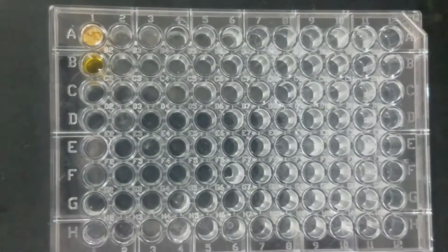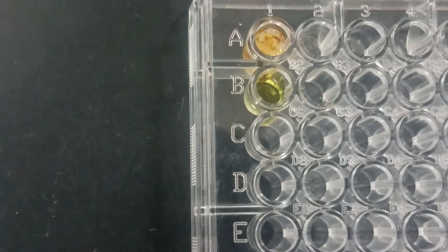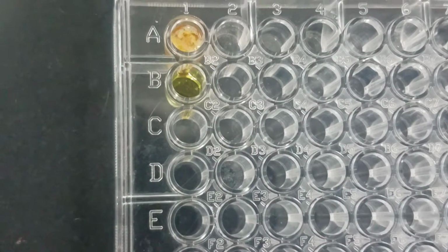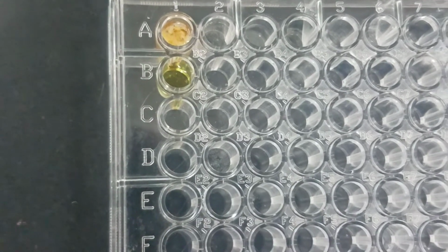All right, so the next experiment is you're going to take, again, the iron chloride and 2 drops, and then I'm going to add sulfuric acid. And sulfuric acid is number 5. Write down, I don't see any change. The iron chloride is a yellow color, and it just seemed to make it lighter or dilute it, but I don't see any precipitate. So I don't see any evidence of this reaction taking place.